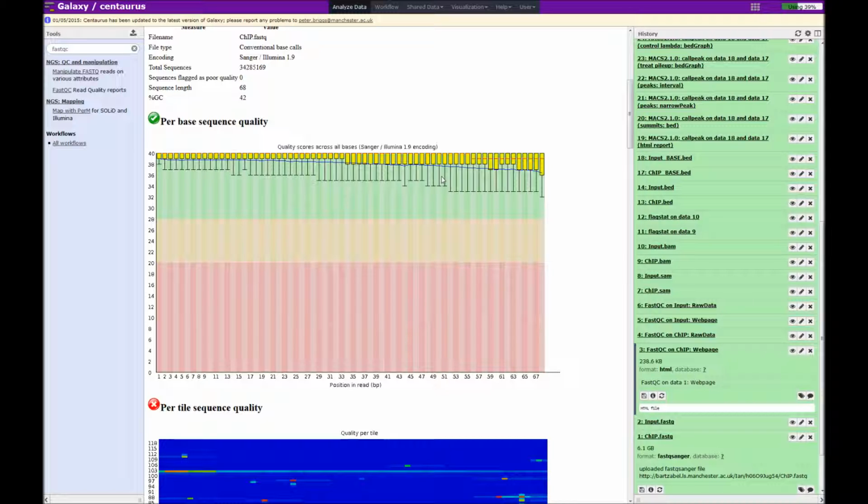In case you're unfamiliar with box plots, the yellow bar indicates the upper and lower quartiles of the distribution. The horizontal bar is the median. The blue line here is the mean value of the distribution, and the whiskers, which would be above and below, are the maximum and minimum values. As you can see here, the maximum value is at the top score of 40.